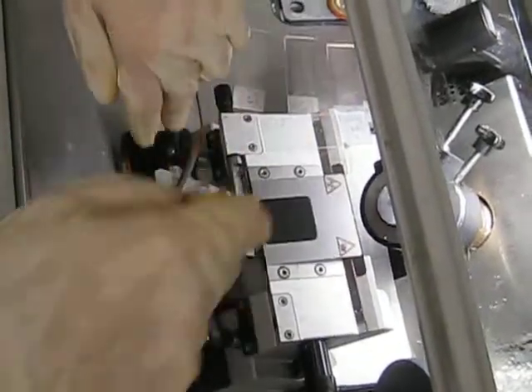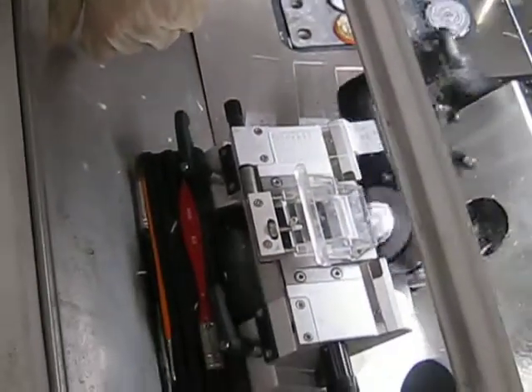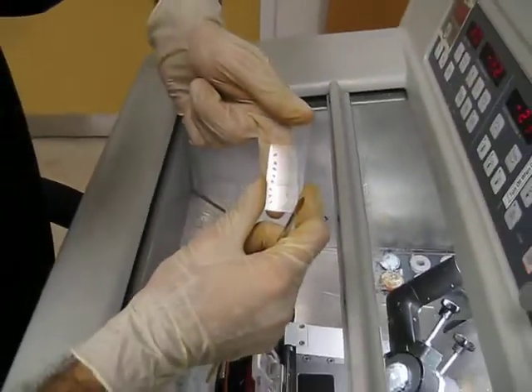I'll just go and collect them at 20 microns because that's a good starter. Make sure your slide is actually warm so it doesn't stick to your paintbrush, because that's going to happen a lot later and you'd want to deal with it now. And then to attach them you just use your finger and they melt on.